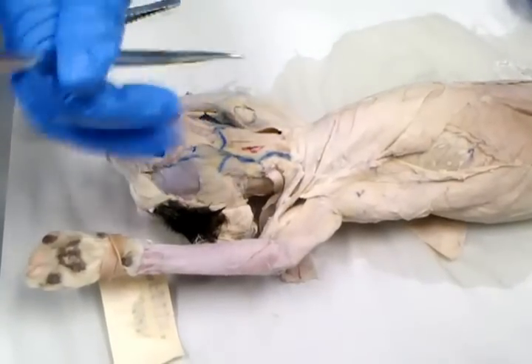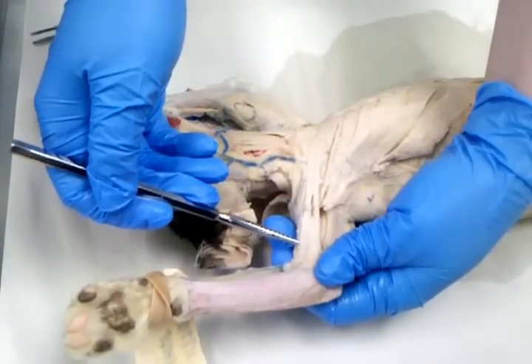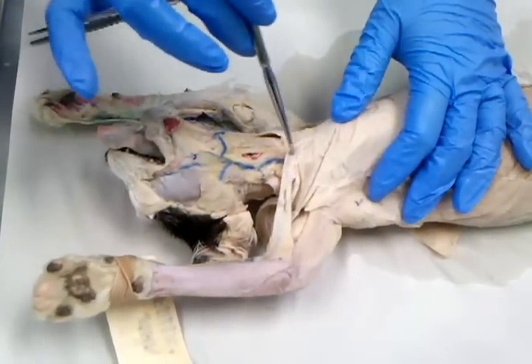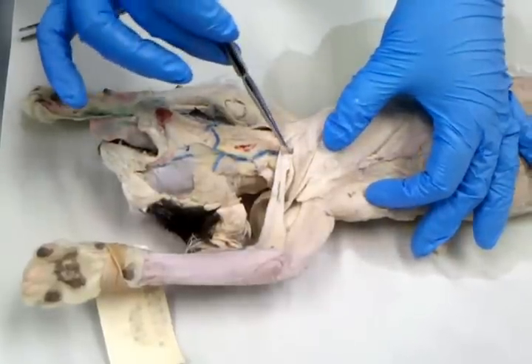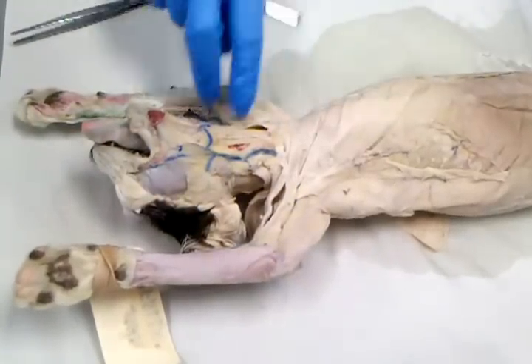This muscle coming from the center of the chest, this thin one, out into the arm, is pectoantebrachialis. If I move it aside, what you're seeing is all of the pectoralis major, from this edge right here to this top edge right there. So that was the four superficial chest muscles.